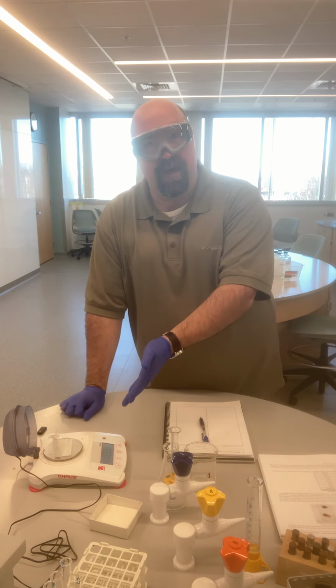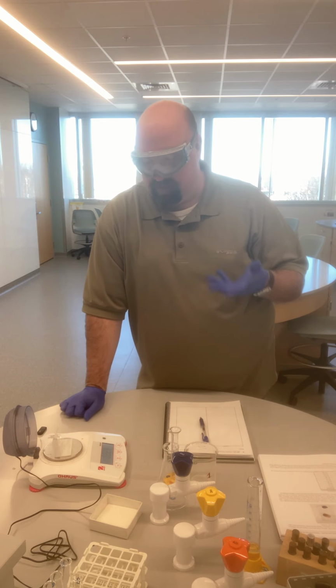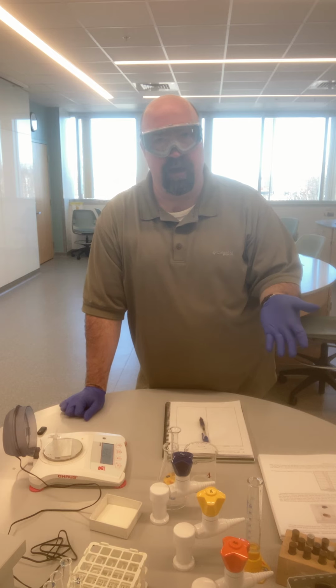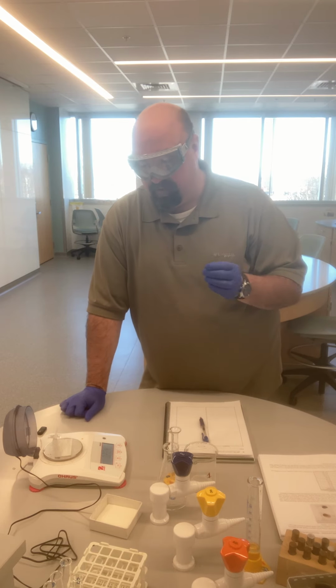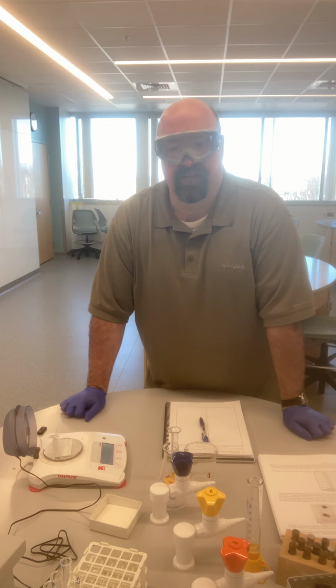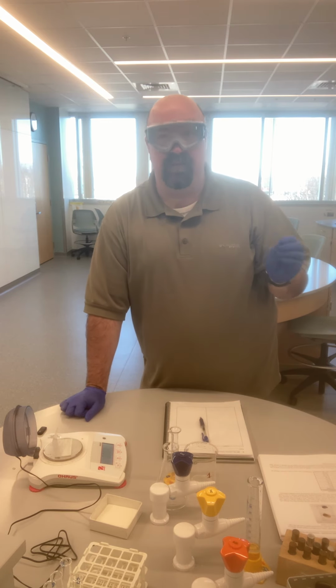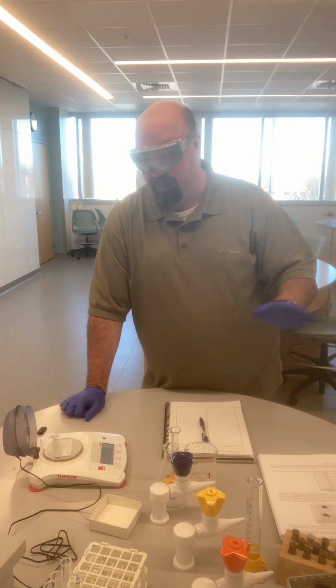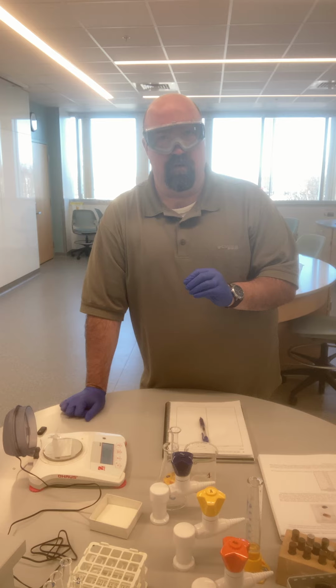I can do a couple things at this point. I can either record that mass and then take the difference in order to find the mass of the solid that I would eventually weigh. Or, and this is a really handy way to use balances, with that weigh paper on there, I can simply press the 0 button, and that tells the balance that whatever is on there right now, I want to say has a mass of 0. So now my balance has the weigh paper on there, but it's recording a mass of 0.